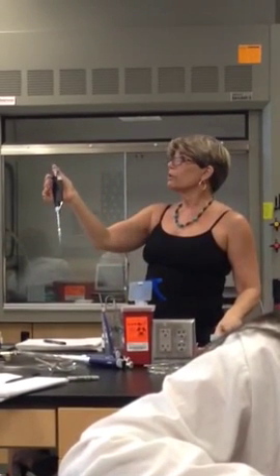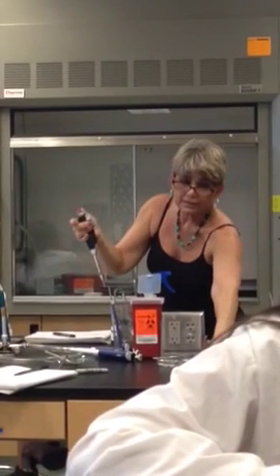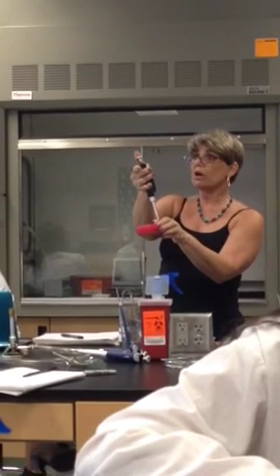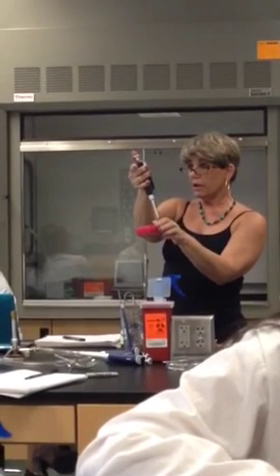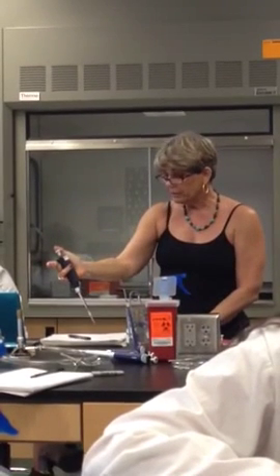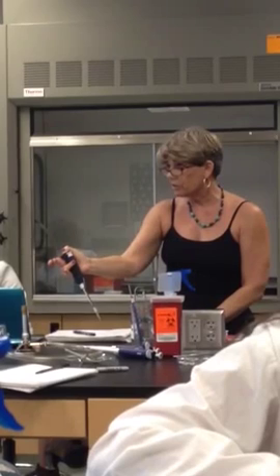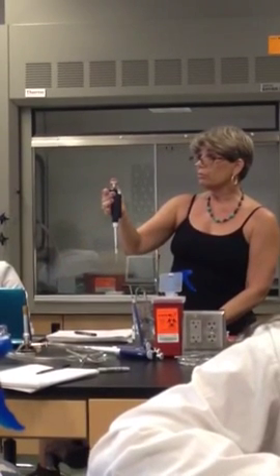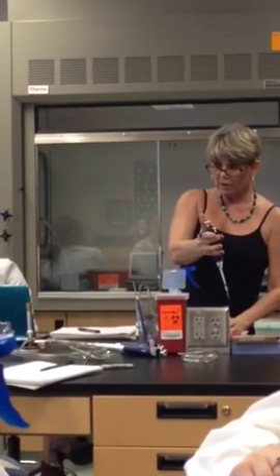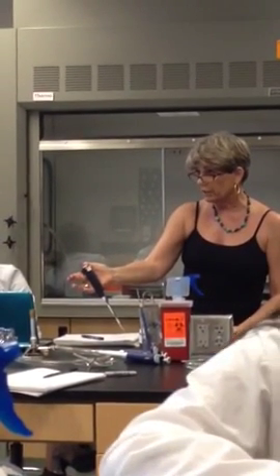Now, I'm going to depress to the soft stop, stick it in my E. coli that I vortexed, withdraw, and it sucks up the E. coli in the broth. Then I'm going to go to my Petri plate and squeeze it all the way out by pressing it past the hard stop, okay? So, gentle stop, suck up your E. coli by releasing it. To squirt it out, press all the way down as hard as you can.